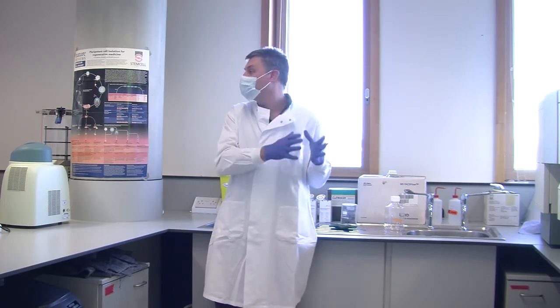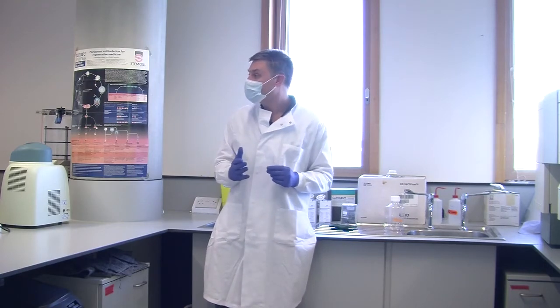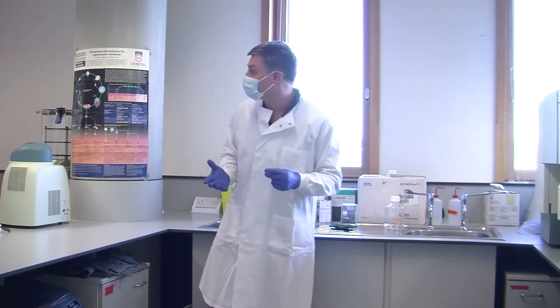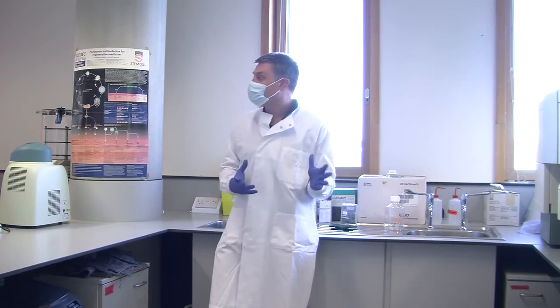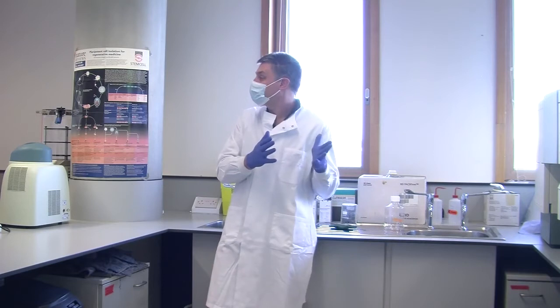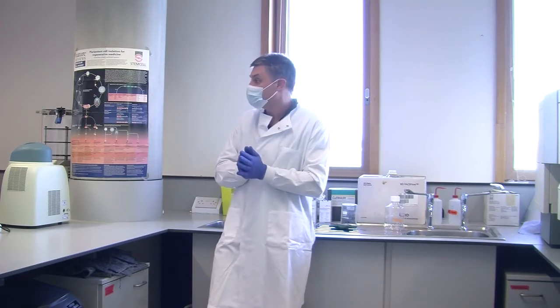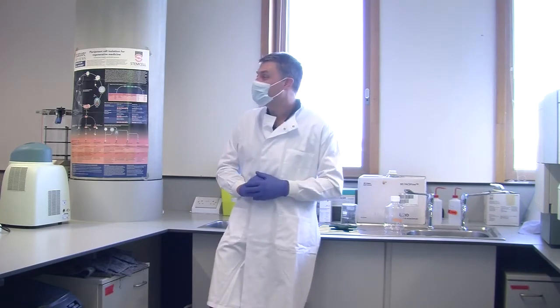Now this is a relatively old instrument. It doesn't have all of the bells and whistles of a modern one. This one can only look at 4 colours at one time, whereas some of the more modern ones can do 35 colours. This one will only run a few hundred cells per second, whereas the modern ones will run many thousands, and so on. But it works, and it does a good job, and this is the only instrument we have, so this is what we use. But it works in the same way as the more modern ones. The modern ones are just a bit faster and flashier. We have more coloured lights, and so on and so forth.